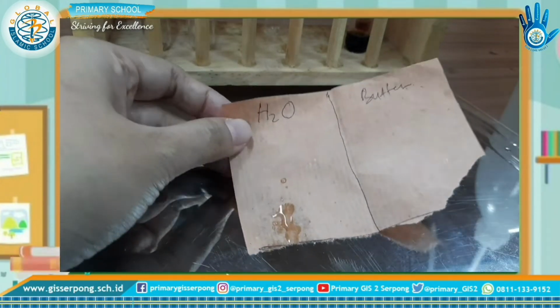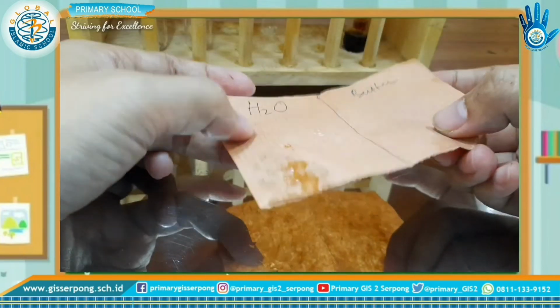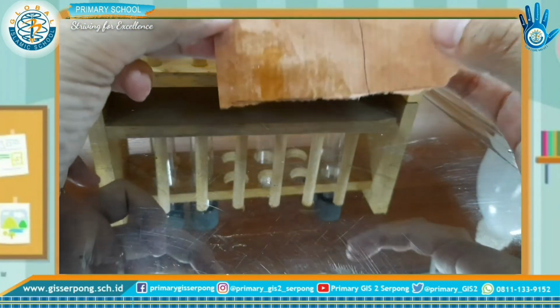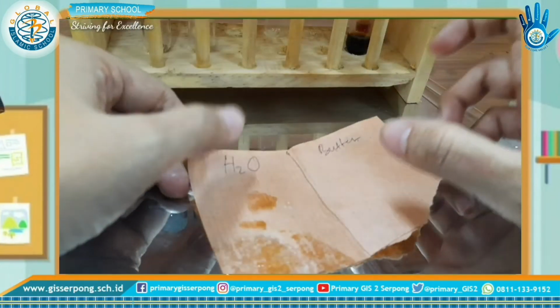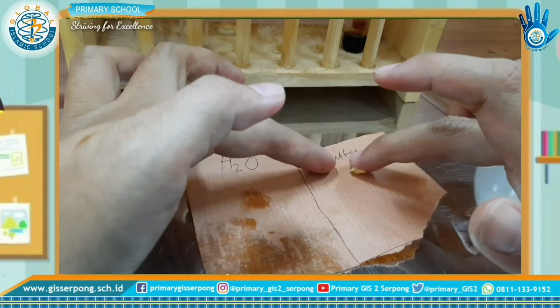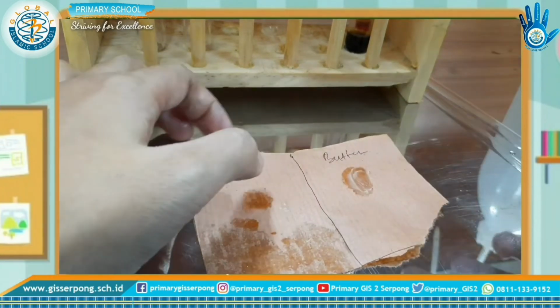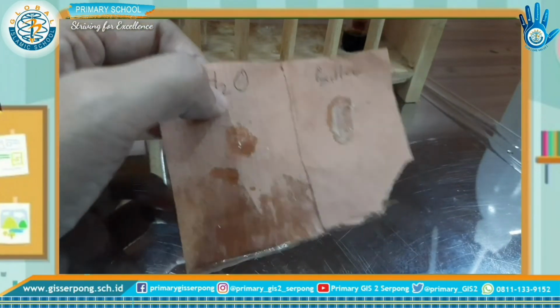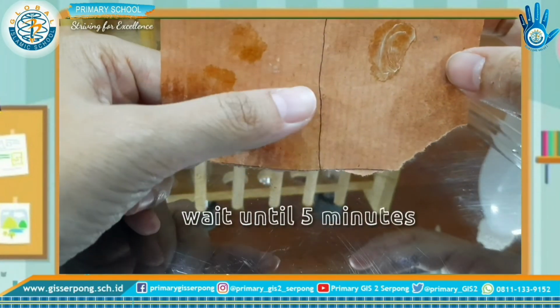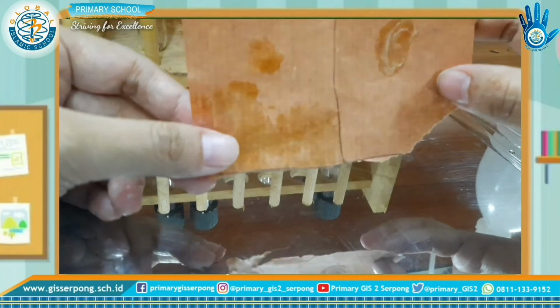Okay, you can use your finger to smear it onto the paper. For butter, you can smear the butter with your finger like this. Okay, and then wait for 5 minutes. After it's dry, you can see the result.